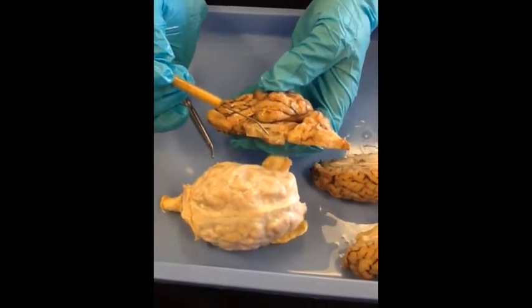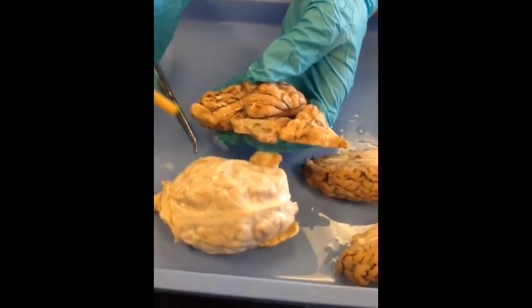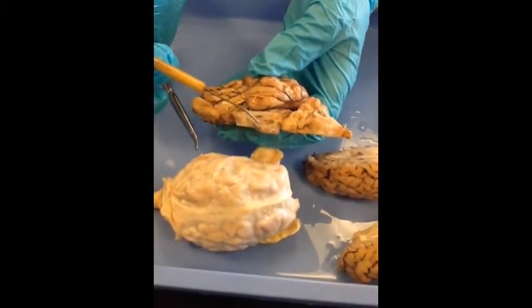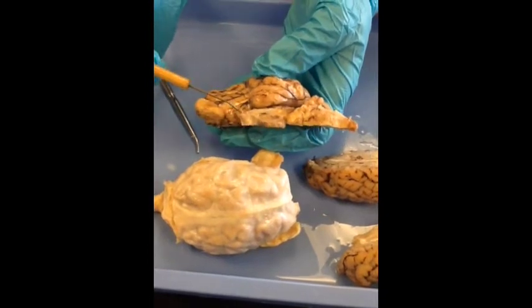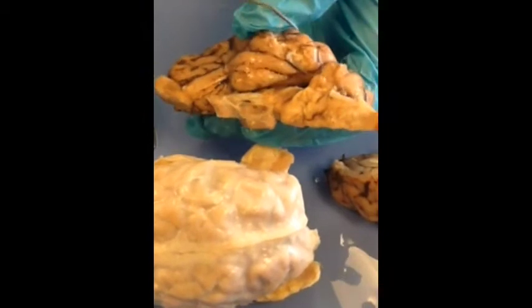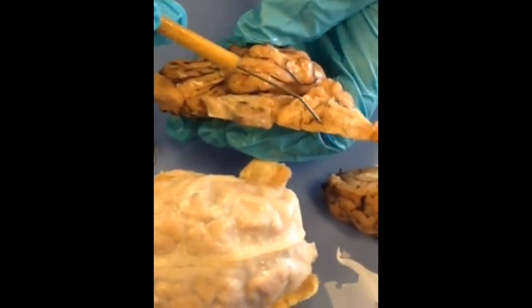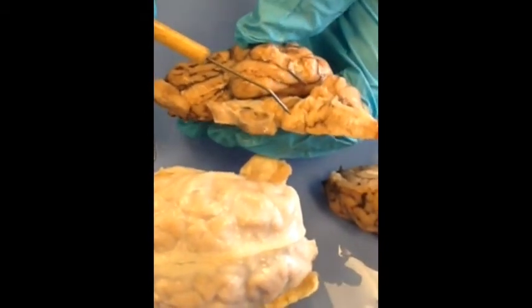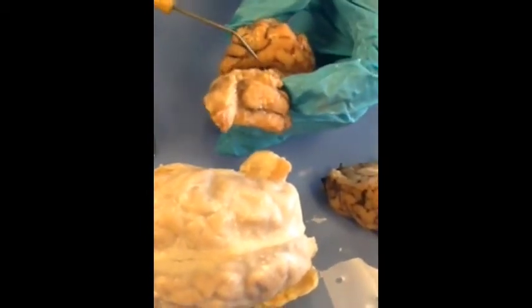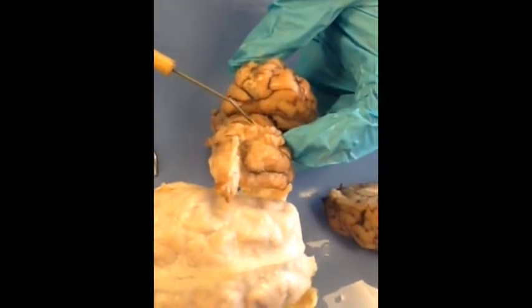This one does have the pituitary still on it. A lot of times when you took the dura off from the ventral surface, the pituitary came off — but this one still has that. Here is part of the optic chiasm. You have your medulla and pons. When you look at it this way, you have your superior colliculi here and inferior below it.